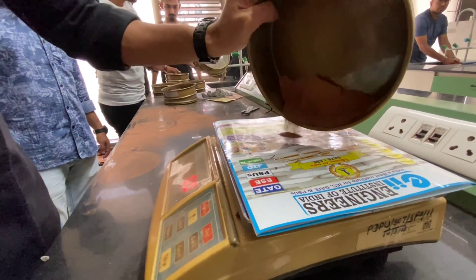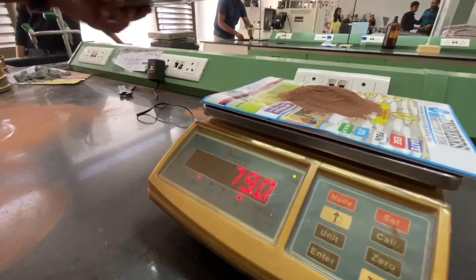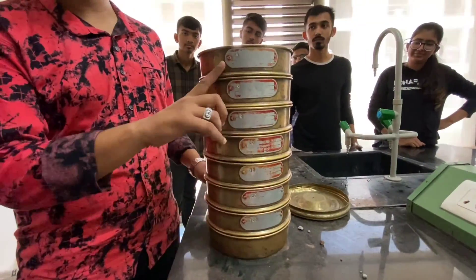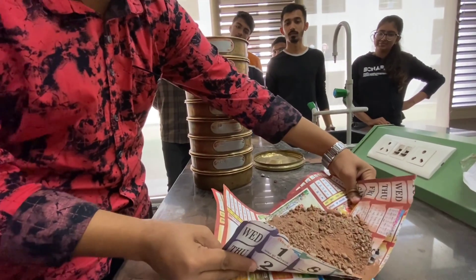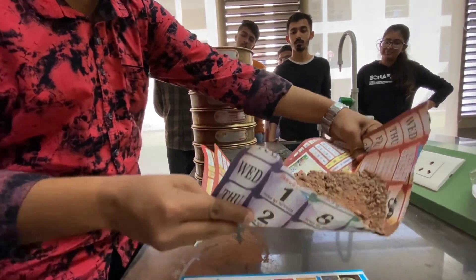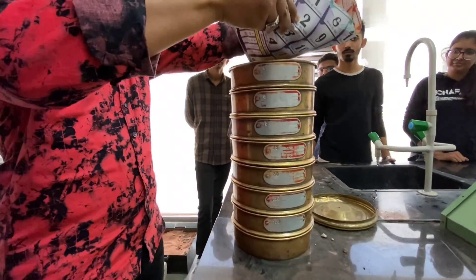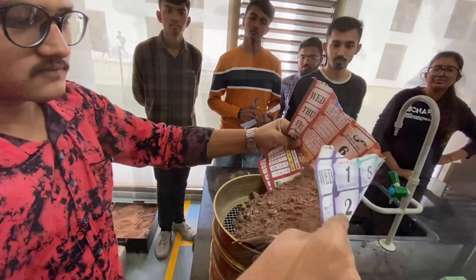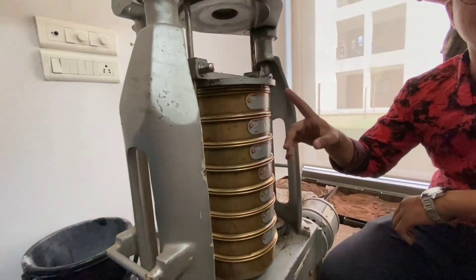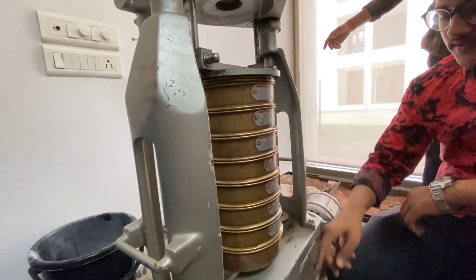Then the undersized particles are weighed. We then start shaking the oversize particles — first the sand is fed to the 4 number screen, and then we start the screen shaker.